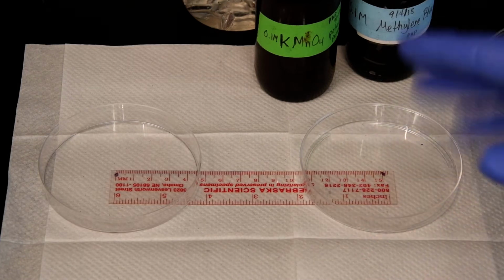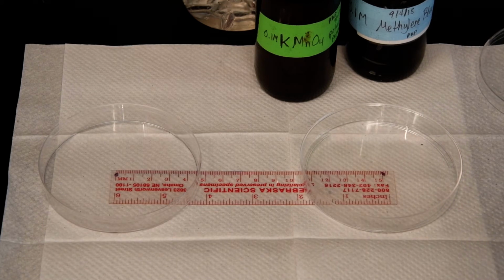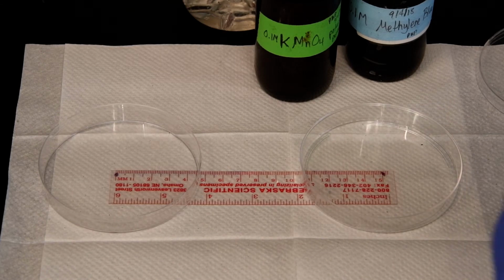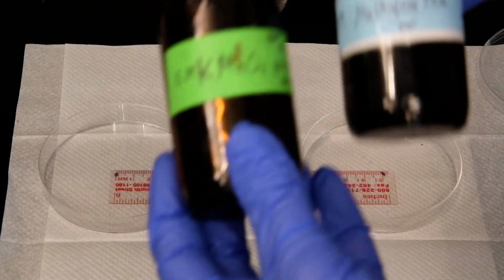Here, I'm not going to bother timing it because they're going to be put in at the same time, basically. But ideally, we'd have a timer, and you can use your phone to do this, or a stopwatch if you have one. It doesn't really matter. All you're trying to do is make sure that the time is constant for both. Just like with the temperature one, I'm not going to watch the time because you're really looking for the effect. And you're going to see that because I'm using two different dyes here, and they have a different size.